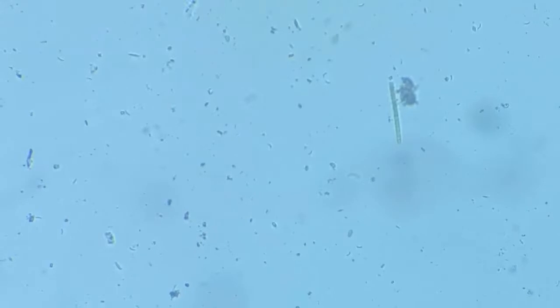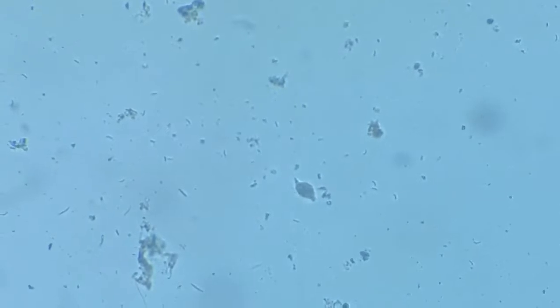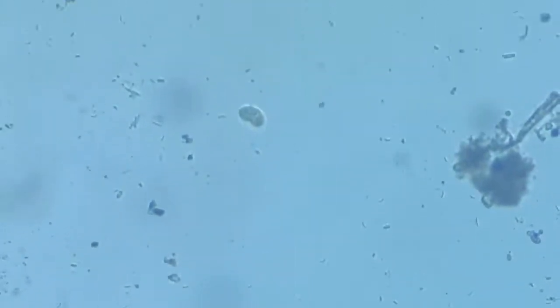There seem to be quite a few amoeba here. If I zoom, I may be able to show you some. But since we've already had an encounter with a very pretty amoeba a while back, I shall move ahead, try to find something more important and more promising.